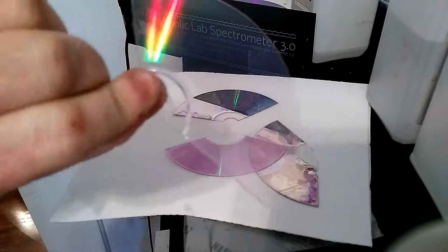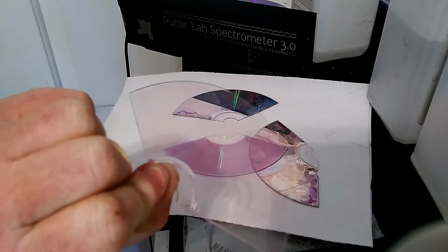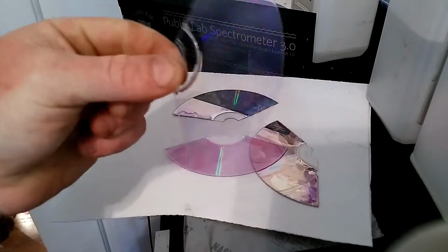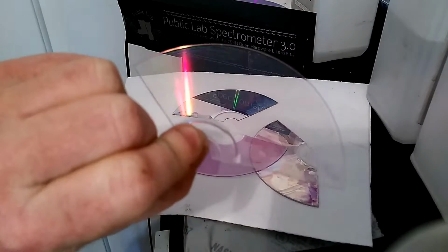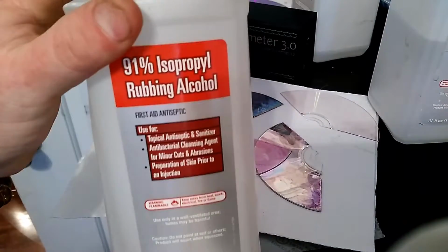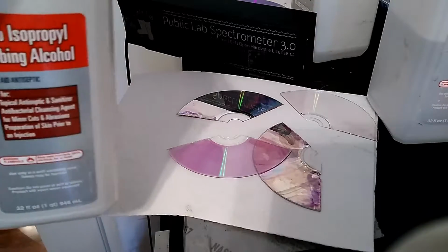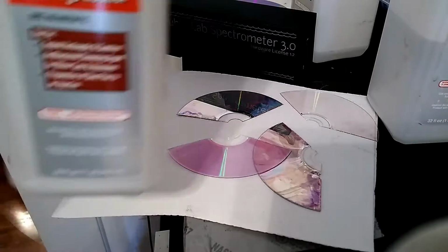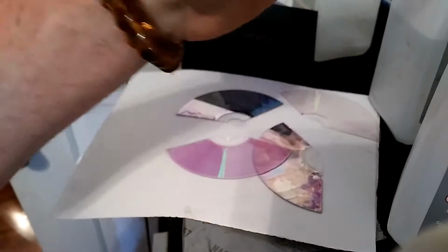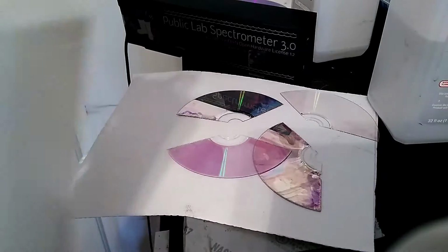This is just pouring it on. You can still see some purple in there, but not a lot. I just poured it on there, and I didn't even have to rub. So if you're having the same problems, maybe it has to do with the quality of the discs. These are Maxell Golds, DVD-Rs, high compression, whatever. So maybe the ink is better, I don't know. But using this 91%, you pour it on, it came right off.